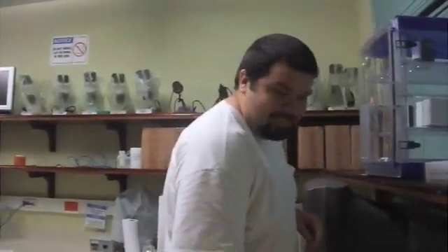Hello, my name is William Schmidt and the camera person is Anna Chan. Today we're going to show you how to make cross sections of algae. That's very important, yes, very important for identification, for everything.